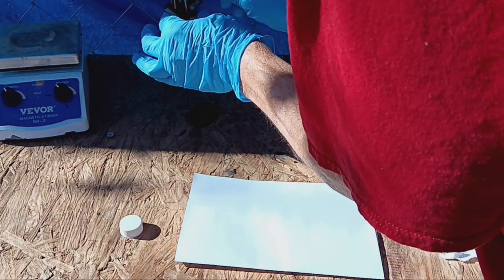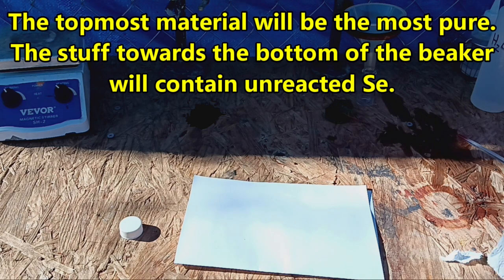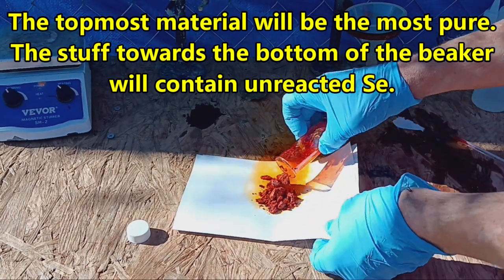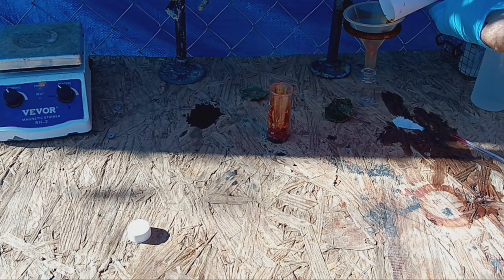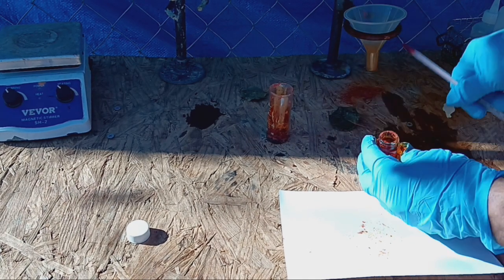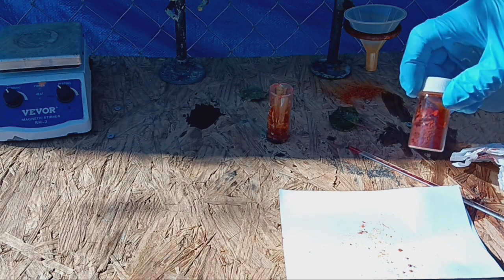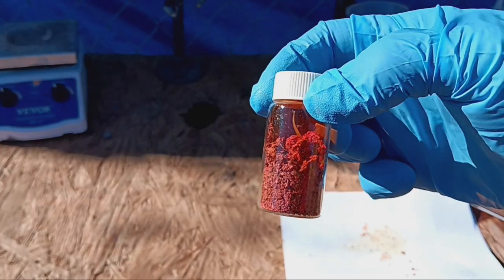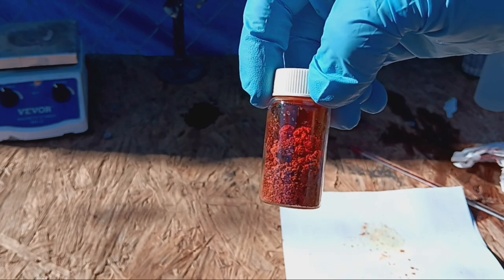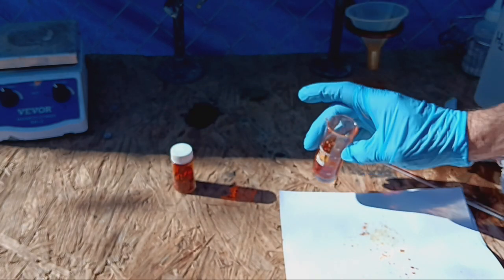All right, here goes nothing. Great big piles of this stuff - it's very damp. We lost some of it but that's okay because we got a shitload of it. Finally! It's about time - I'm sick of inhaling bromine trying to get this to work. There's still more of it in there.